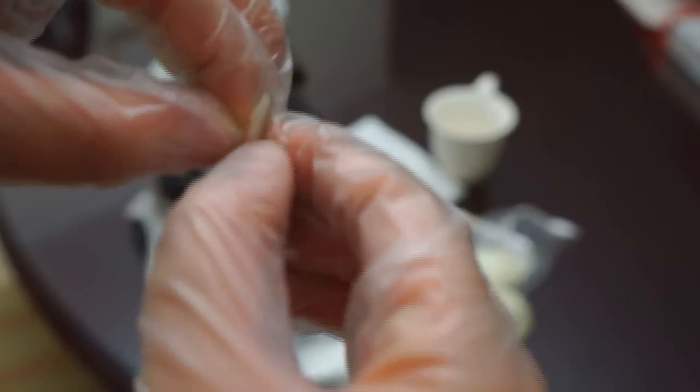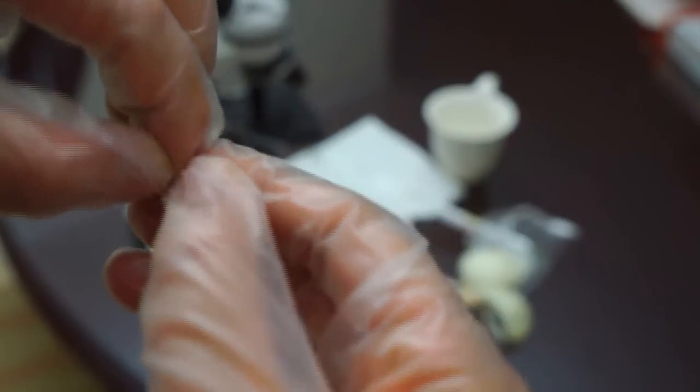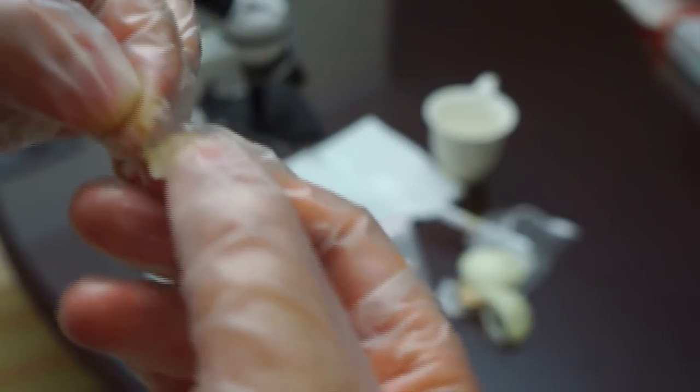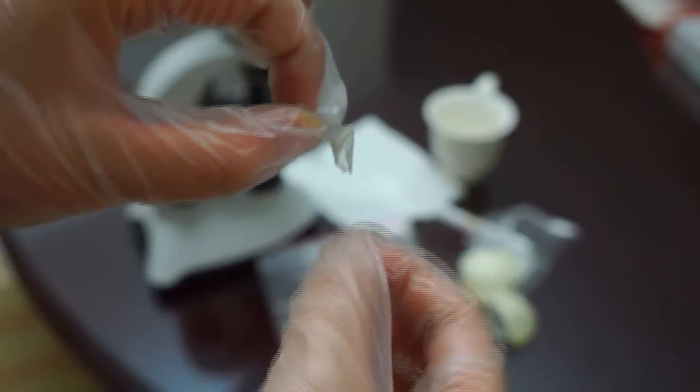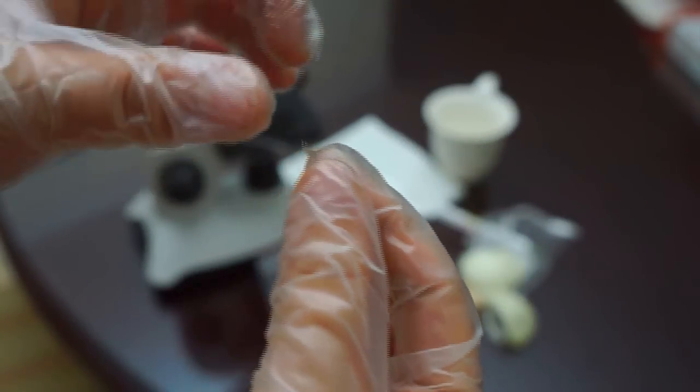This helps us handle it easier. But it is not necessary as long as you have a decent amount. Here you can see it. We are going to put it aside for a moment.